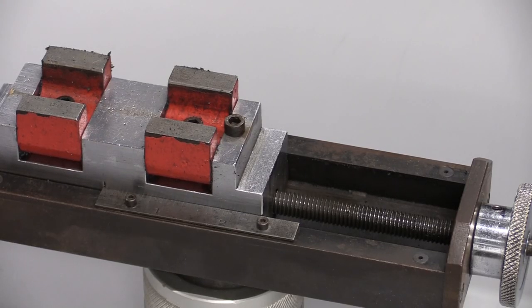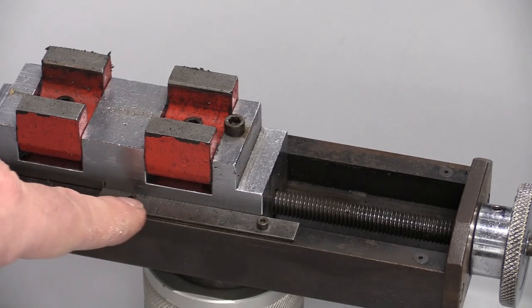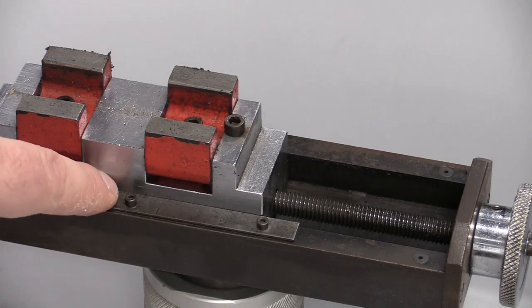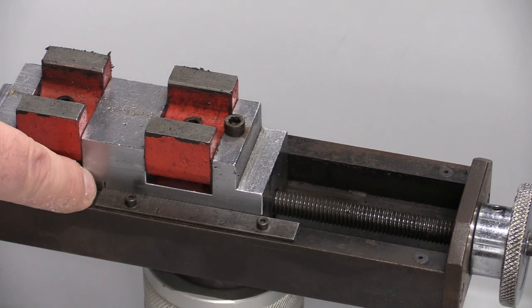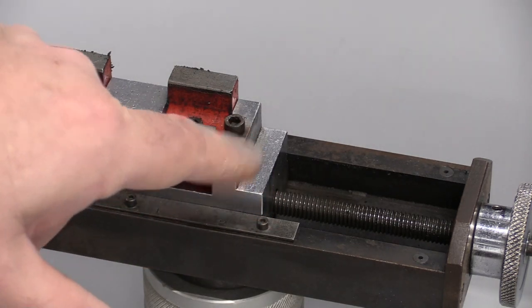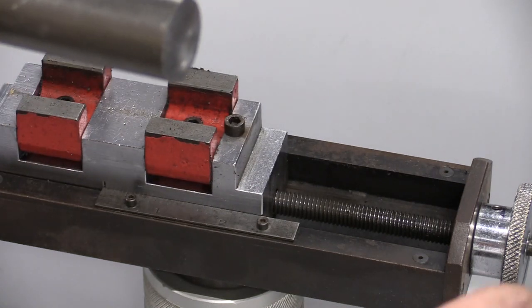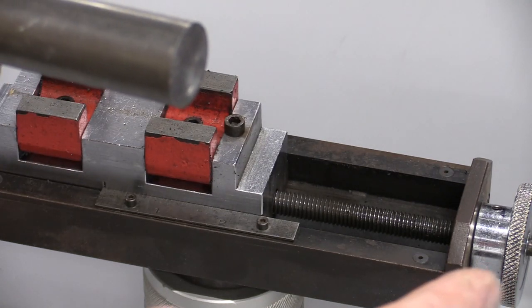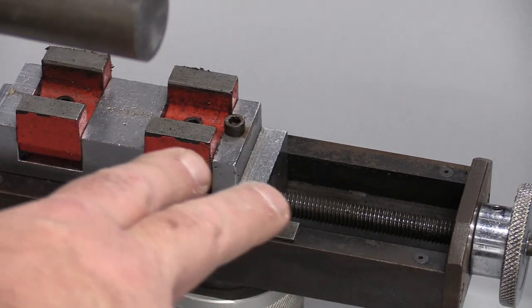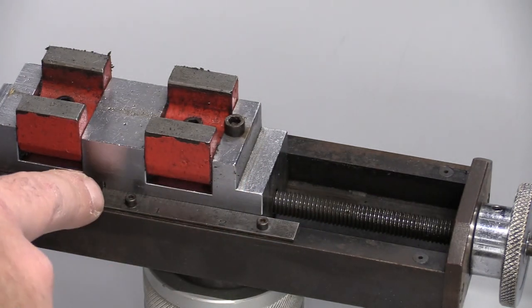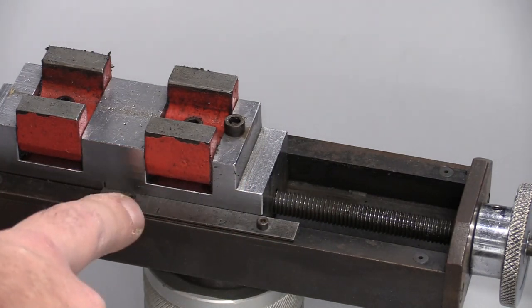Let's talk about the Jominy test fixture here. There's a scale right here and there's a little line on this block that you want to have set down here at zero. There's a little stop right here that is going to locate the end of the bar. If we turn the knob right here it's going to move this whole sled this direction, and we're going to be able to measure our displacement using this scale.